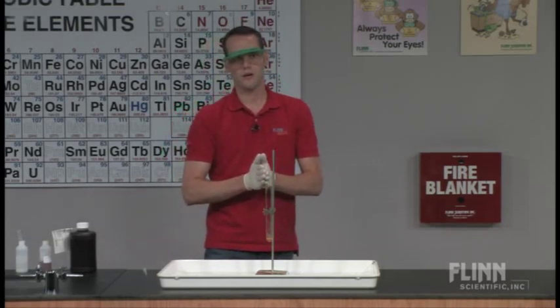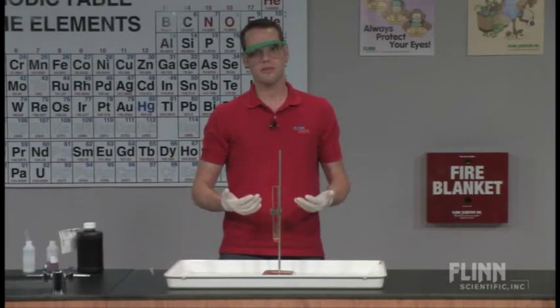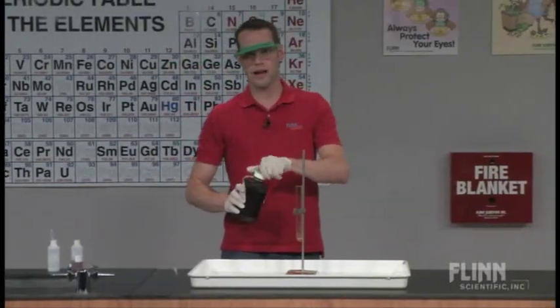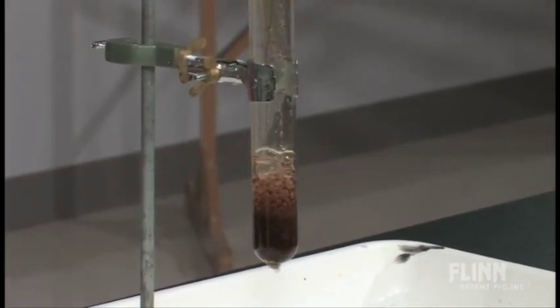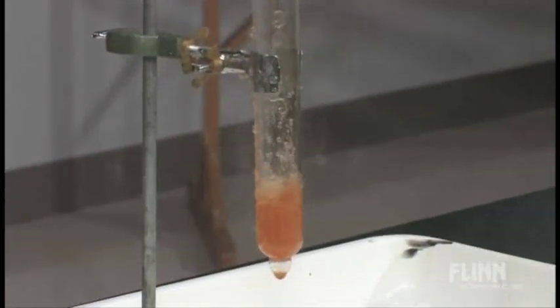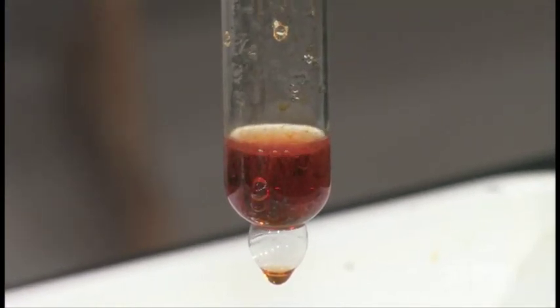The interesting thing about a catalyst is that it isn't used up as part of the reaction process. So if a catalyst isn't consumed and is put back at the end of the chemical reaction, I should be able to use this again. If I pour some more hydrogen peroxide in here, we should see the exact same chemical reaction — just a little bit this time to see the bubbling. You can see again that dark brown reaction intermediate is formed, the rapid evolution of oxygen gas, and the reaction foams over again. After the reaction's finished, we go back to that yellow-orange color that we saw for iron chloride. You can do this multiple times and show students that a catalyst keeps being reused.